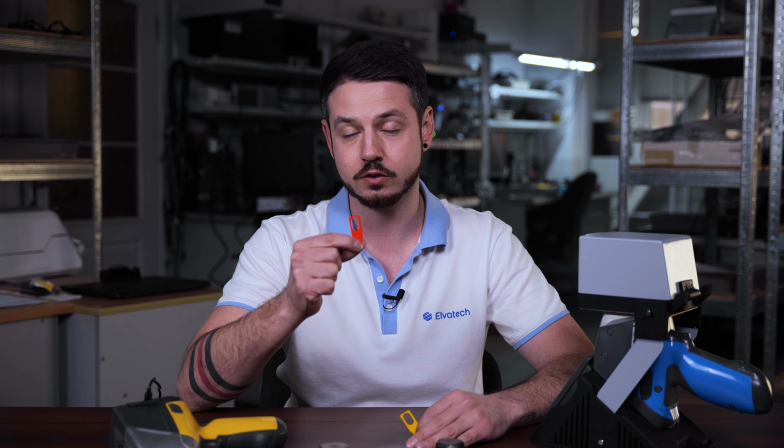materials. Using the correct protective cartridges is crucial for the accuracy of your analysis. ProSpector 3 uses two types of cartridges. For analysis with light elements, we use Ultralene, the red ones, and for analysis without light elements, we use Kapton, yellow ones. The cartridges are easy to change and are suitable for different applications. For example, a standard cartridge is suitable for analyzing most metals and alloys.